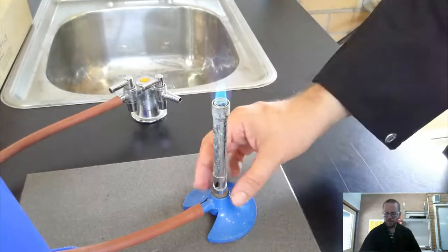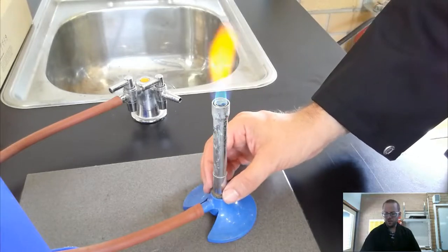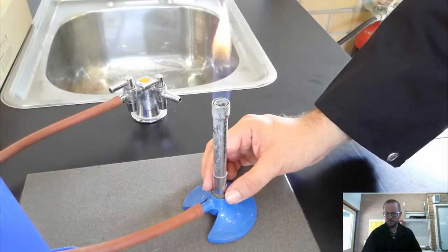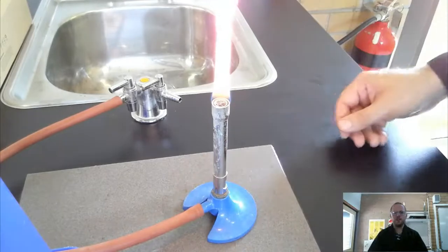And then if I'm at a point at which I'm not heating it, but I need to keep it on, then I'm going to switch to my yellow safety flame. You can hear the difference in the sound. You might have picked that up in the microphone. So we have our nice safety flame.